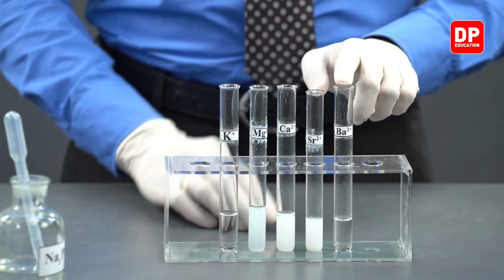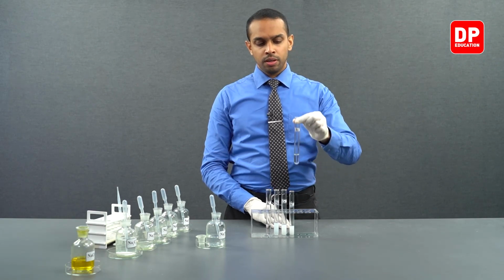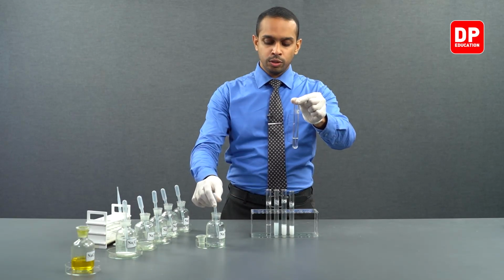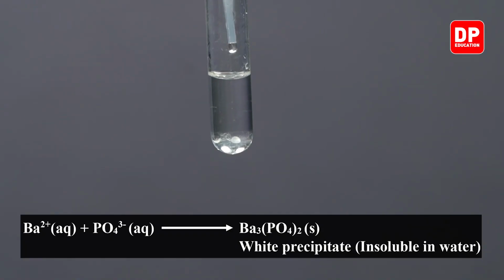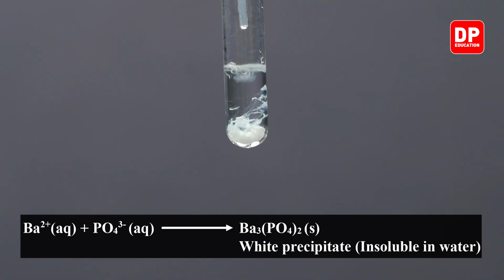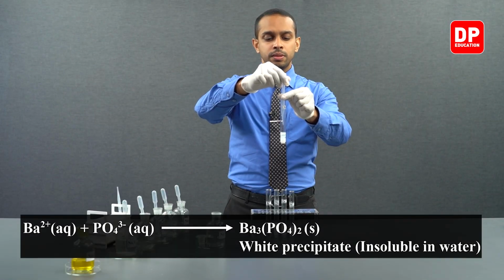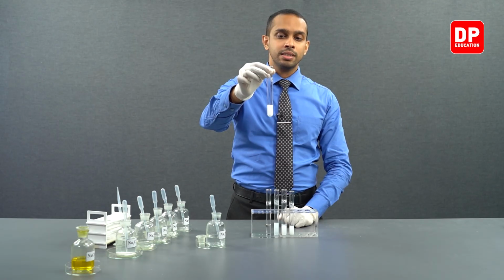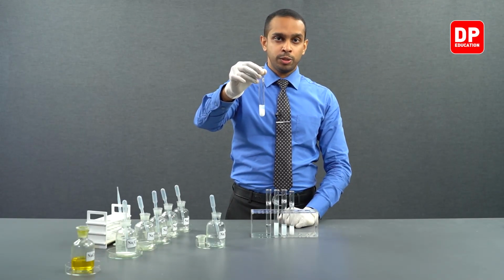Now, we move on to barium 2+ aqueous ion solutions. To this barium 2+ aqueous ion solution, let's also add sodium phosphate. As you can see, when you add sodium phosphate drop by drop, just like in the previous 3 group 2 cations, what you can see here is barium phosphate, a white color, water-insoluble precipitate formed.